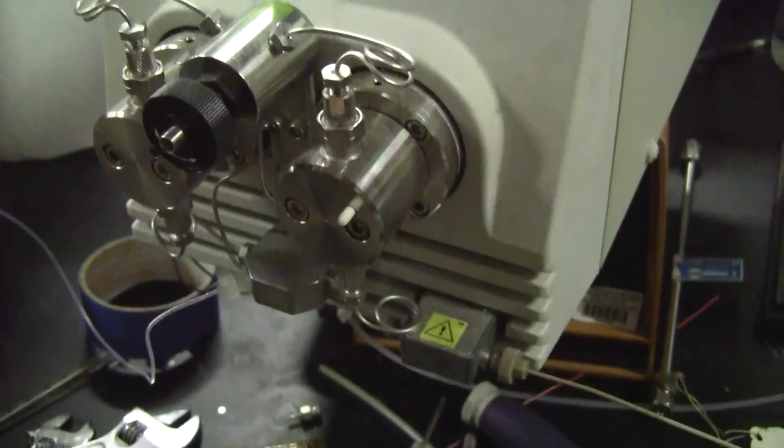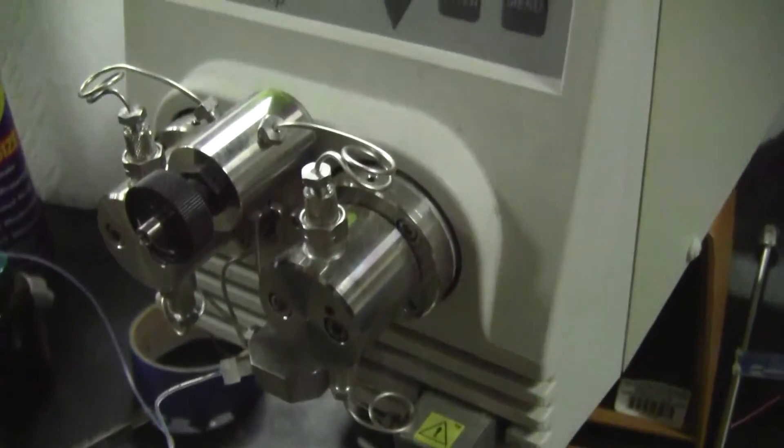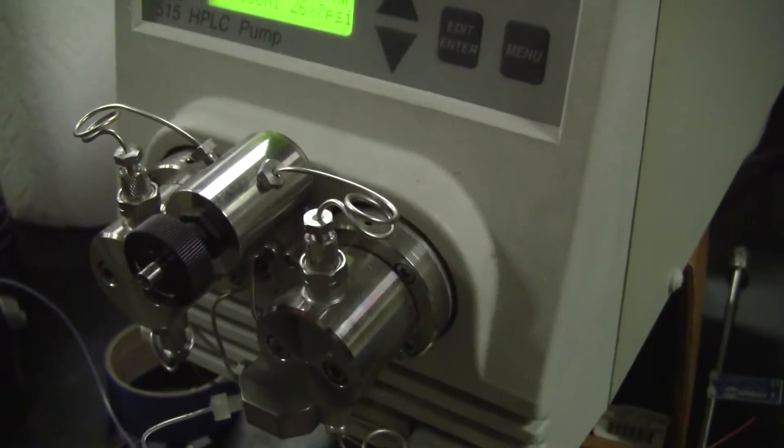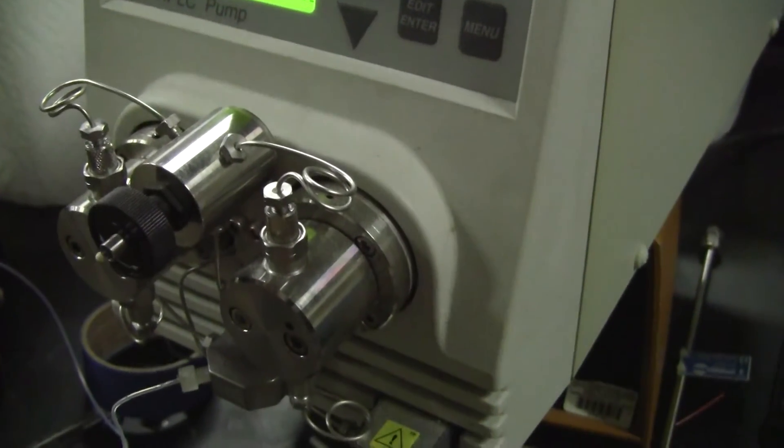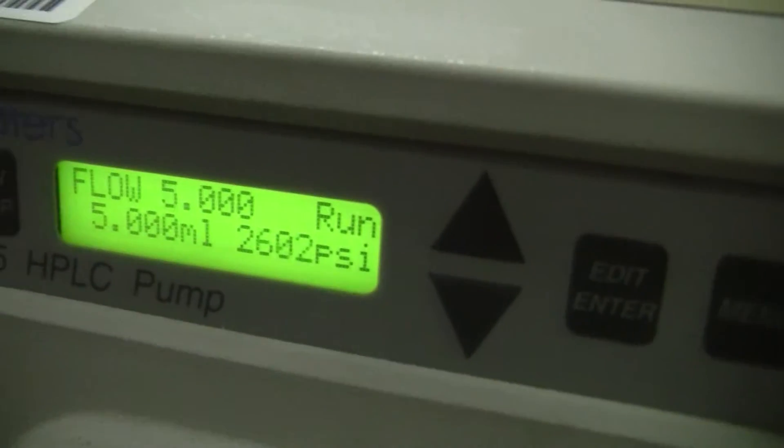20 seconds to go. Building up liquid level. The anticipation is just... 10, 9, 8, 7, 6, 5, 4, 3, 2, 1.